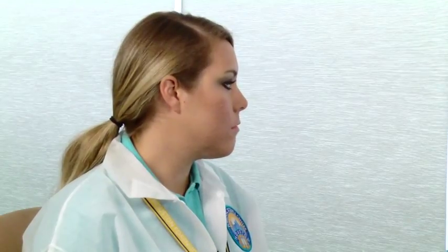Callan, I have a case that I need some forensics work done, and I understand I need to get into LIMS to make a request. How do I find LIMS? How do I get into it?